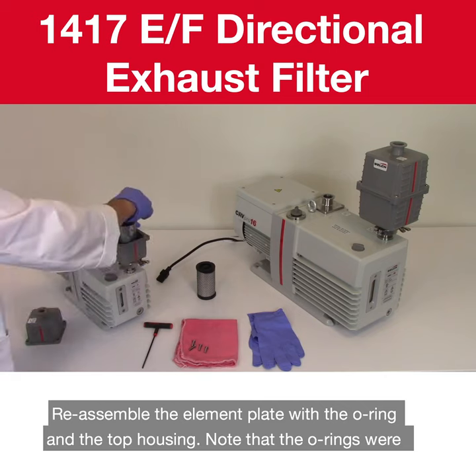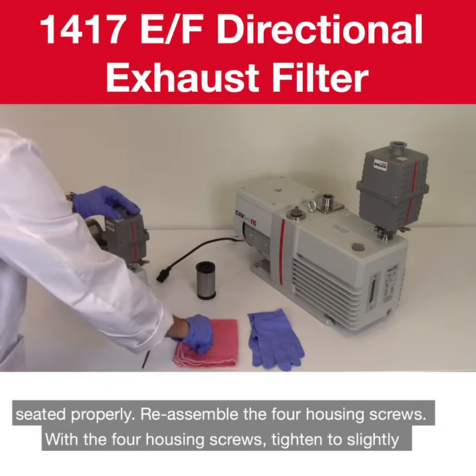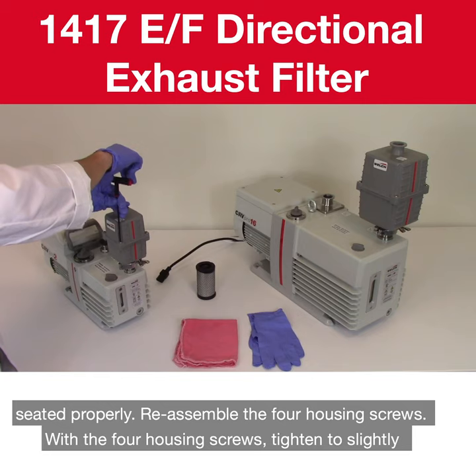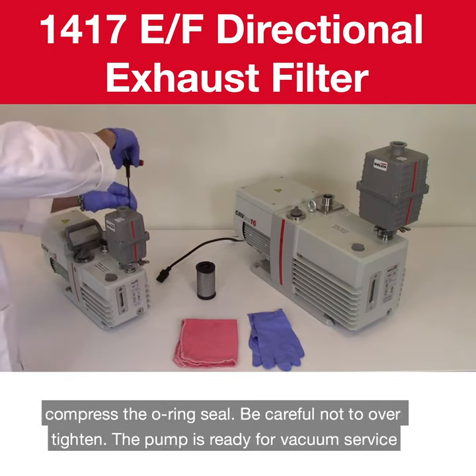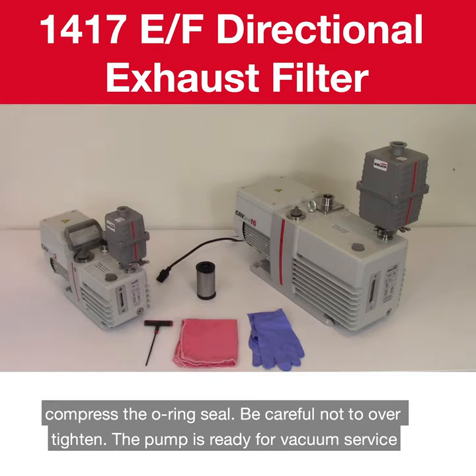Reassemble the element plate with the O-ring and the top housing. Note that the O-rings were seated properly. Reassemble the 4 housing screws. With the 4 housing screws, tighten to slightly compress the O-ring seal. Be careful not to over-tighten. The pump is ready for vacuum service.